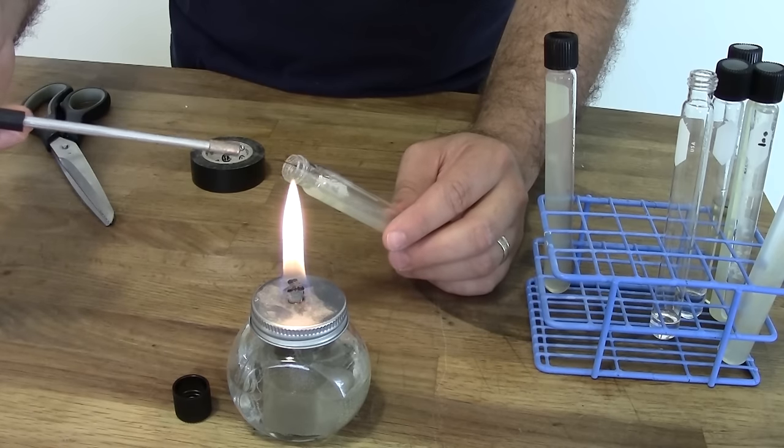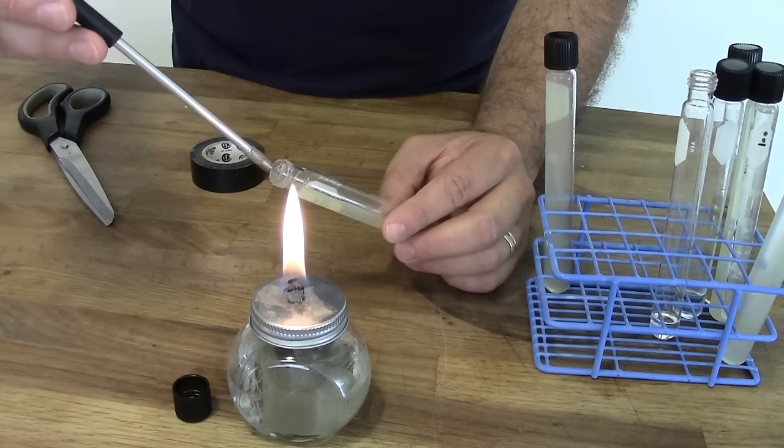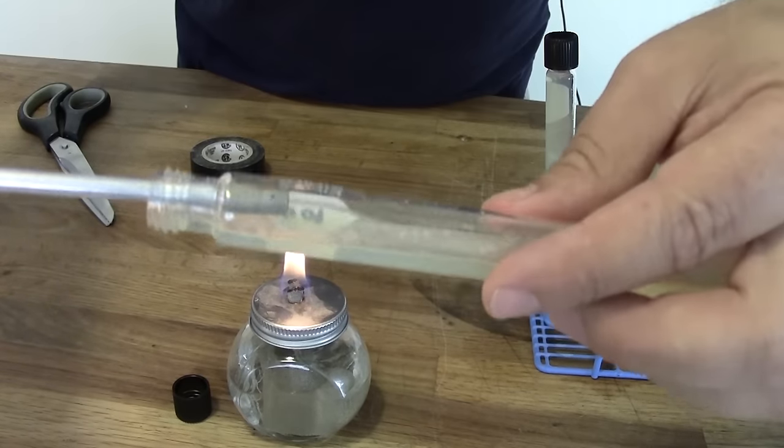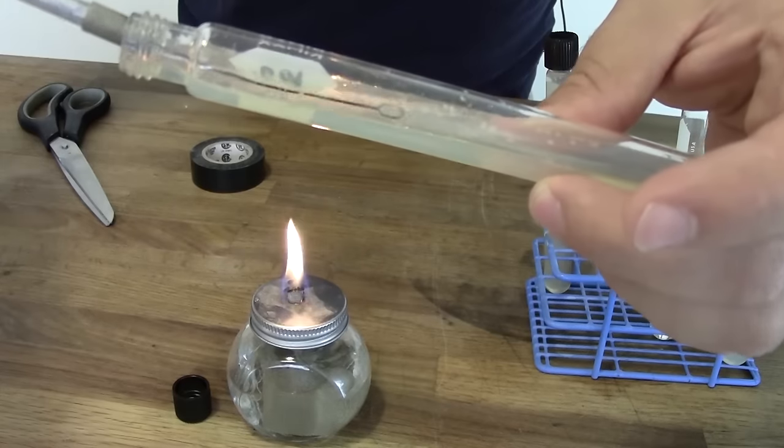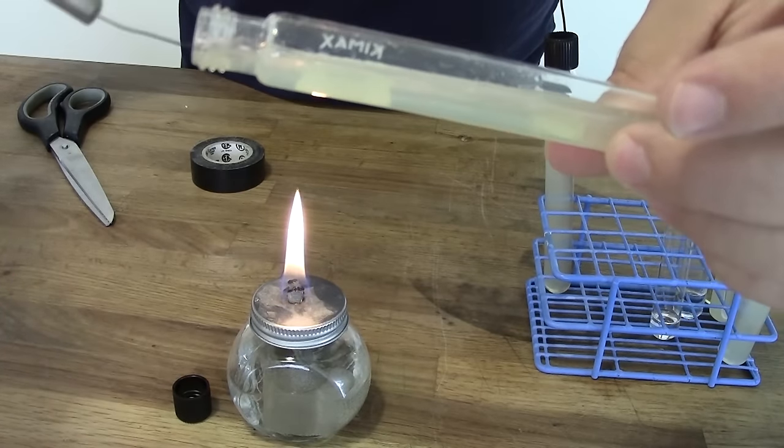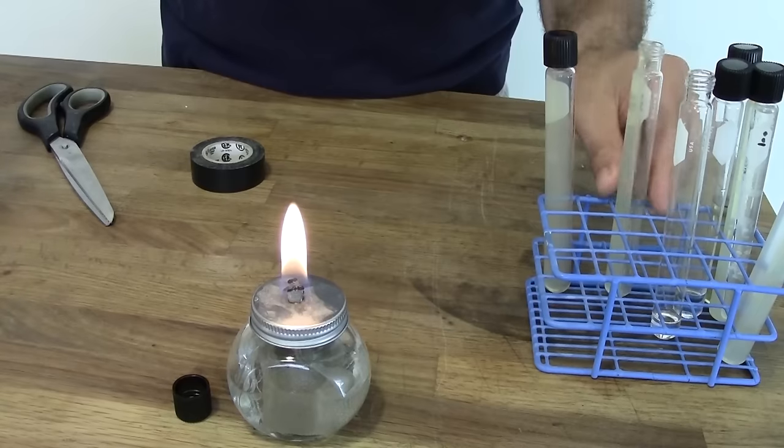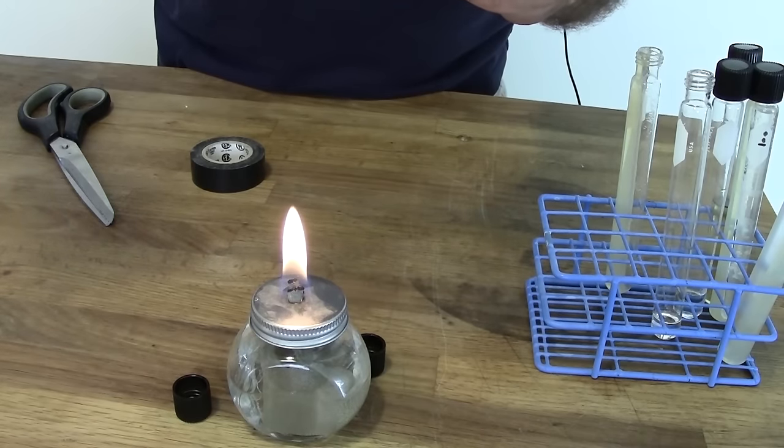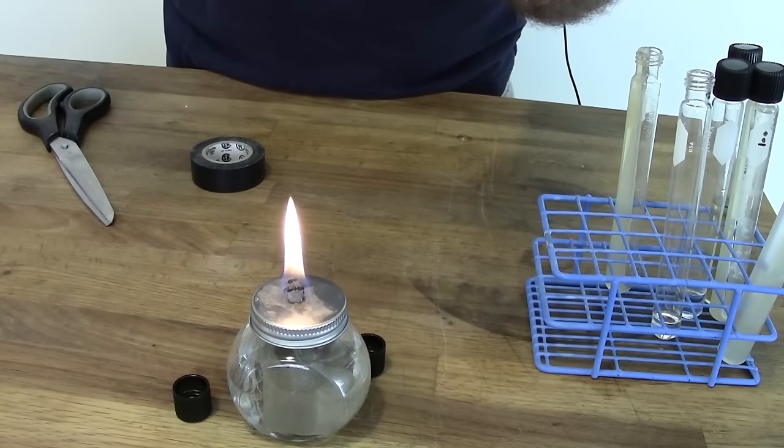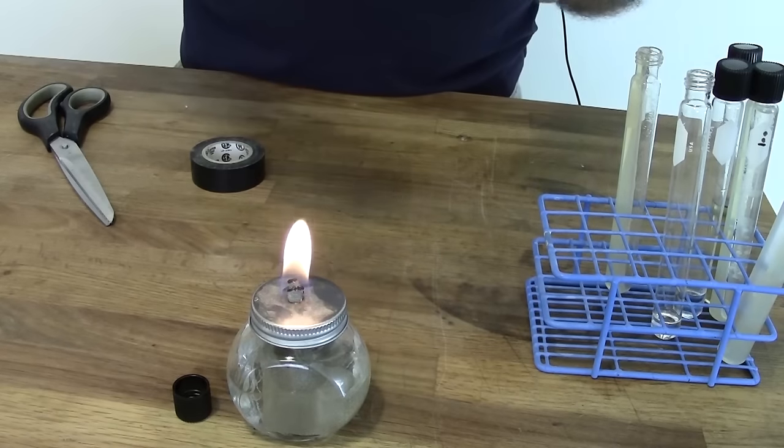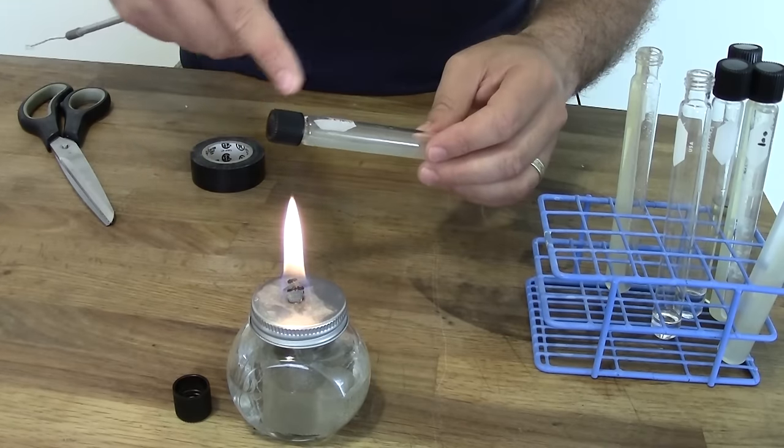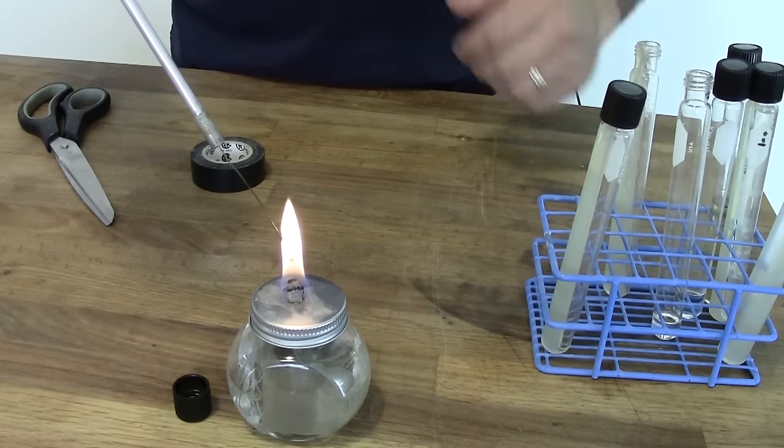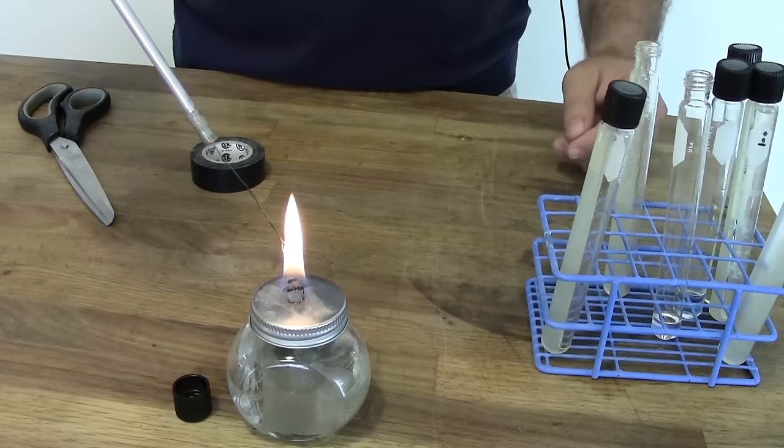Once that's cool, we're just going to grab a bunch of yeast. I don't know if you can see that there, but I've scraped up a bunch of colonies. Here let me see if I can give you a better shot of that without burning myself. So here I'm scraping colonies up off of the gel. And so again on the end of the loop there, maybe you can see that there's a little bit of white. That'll be our yeast. And we're just going to take this yeast, and onto our fresh slant, we're just going to streak this out, just like we did when we were doing this fresh. So all the way down to the bottom, and we'll streak our way up. And then again we did it just exactly like we did last time. Loosely cap that tube so that fermentation products like carbon dioxide can get out. Keep that someplace warm for a few days. And once that time has passed, you want to seal it up. Add the water, the mineral oil, whatever it is you are to keep this tube going. And then put it back in your fridge.